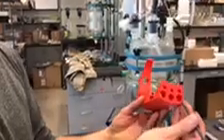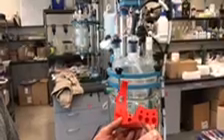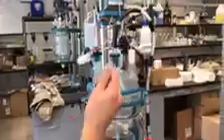But what we've got here is, this is where our dissolved oxygen probe goes. This is where our ORP probe goes. And this is where our pH probe goes. This is where the temperature probe, which is right back here, and it came with this reactor. This will actually hold and pin it in place because this is a fixed location onto the glass, where these probes were actually being supported entirely by this piece.